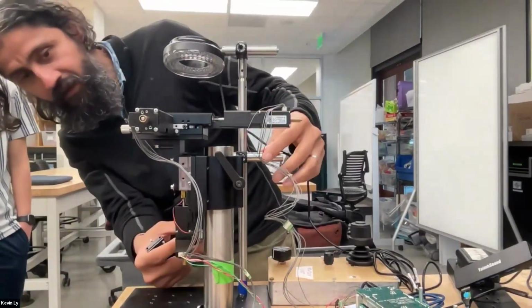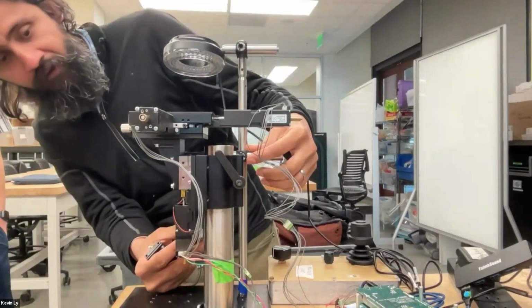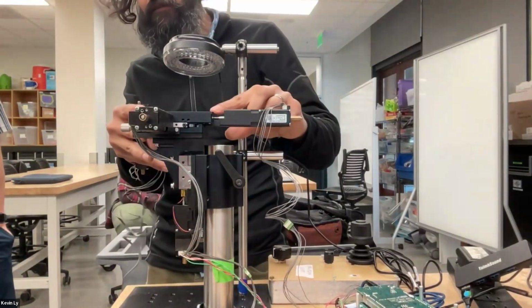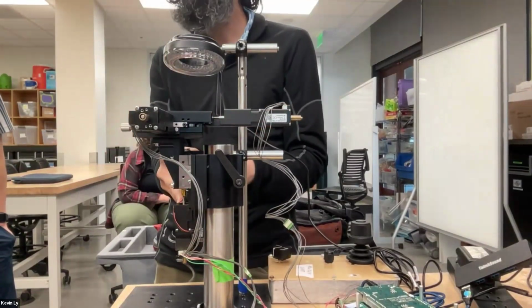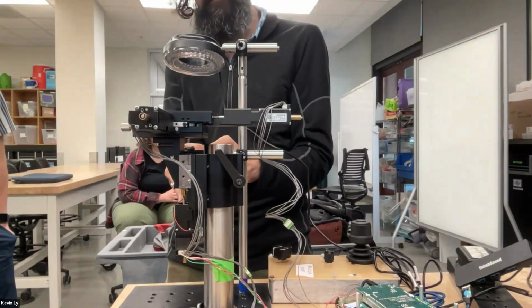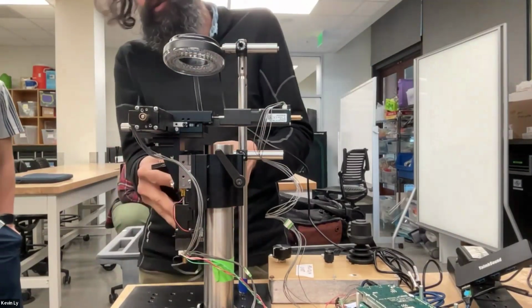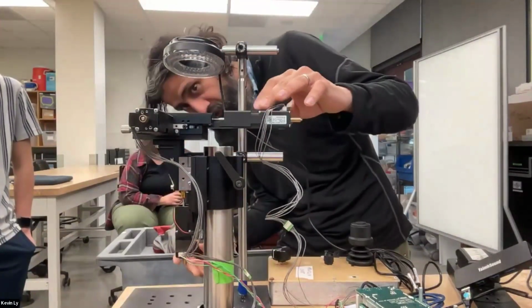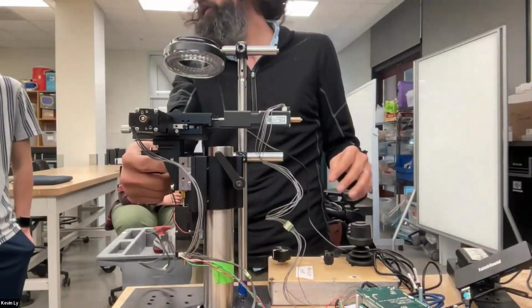So you can see that in this sort of a context, this particular design, the stage is moving and the optics is frozen. Sometimes we do the stage separately and we mount this on the optics. So there are different sets of design. Usually I prefer that we decouple the two, where this is not on top of this.